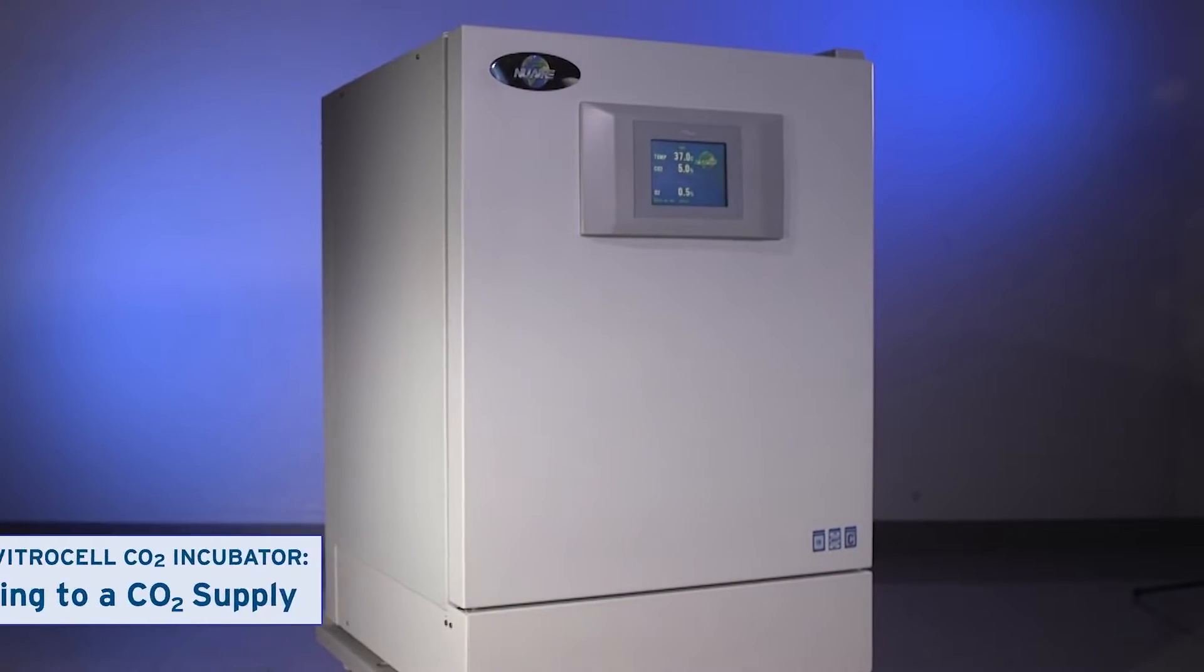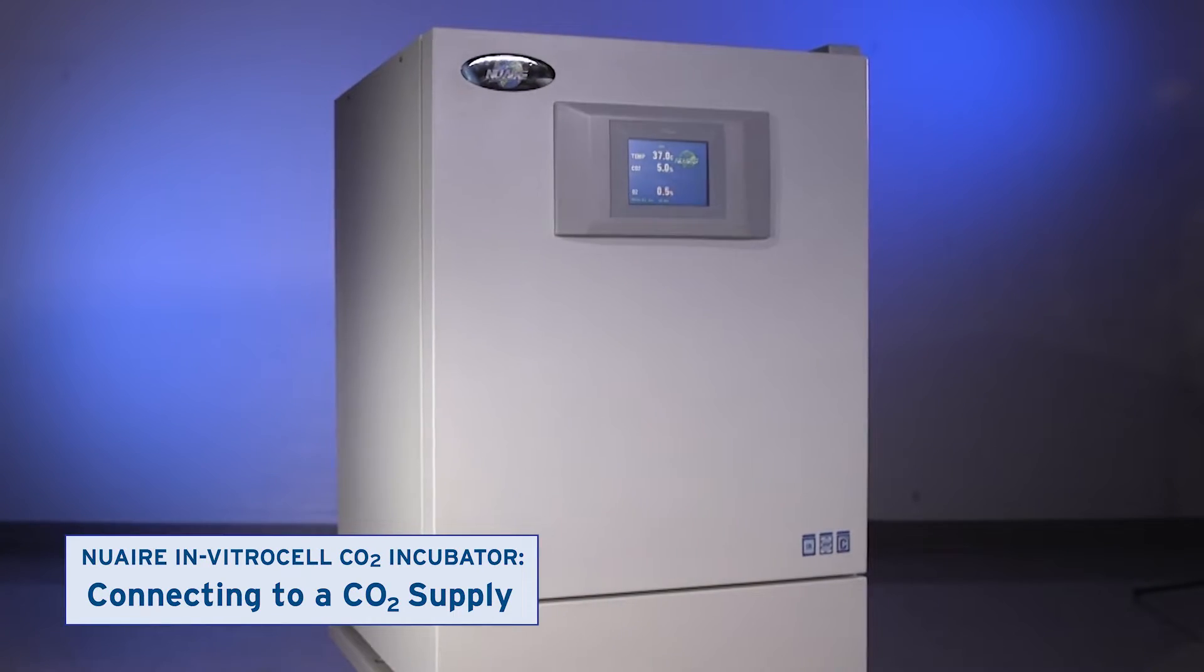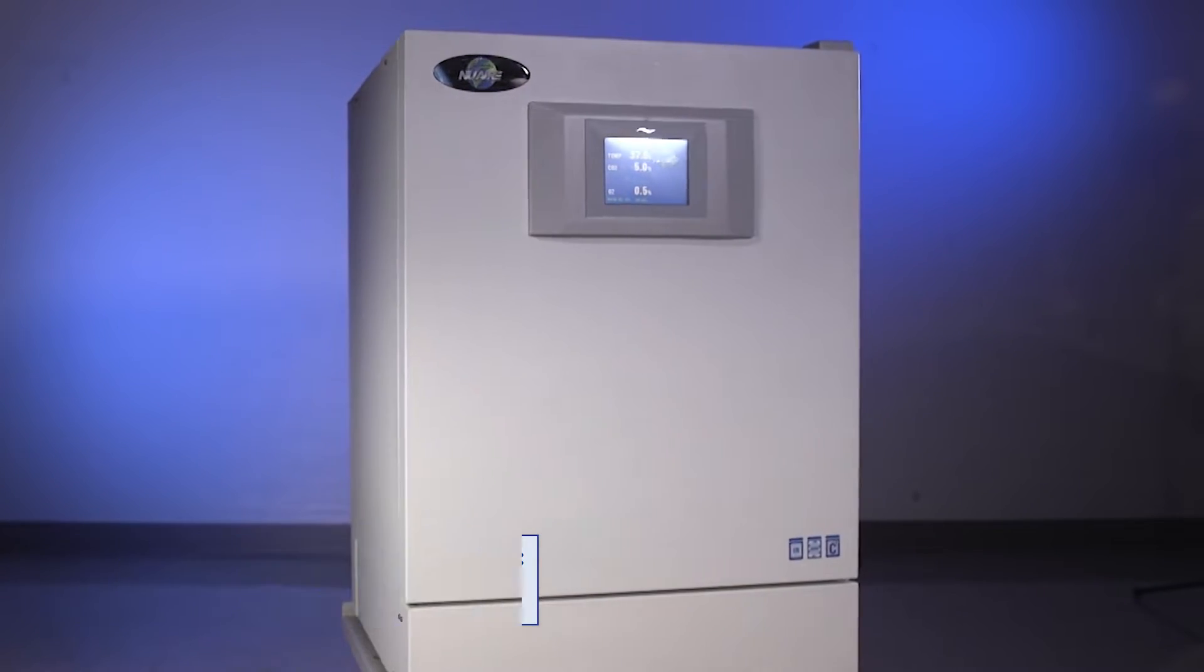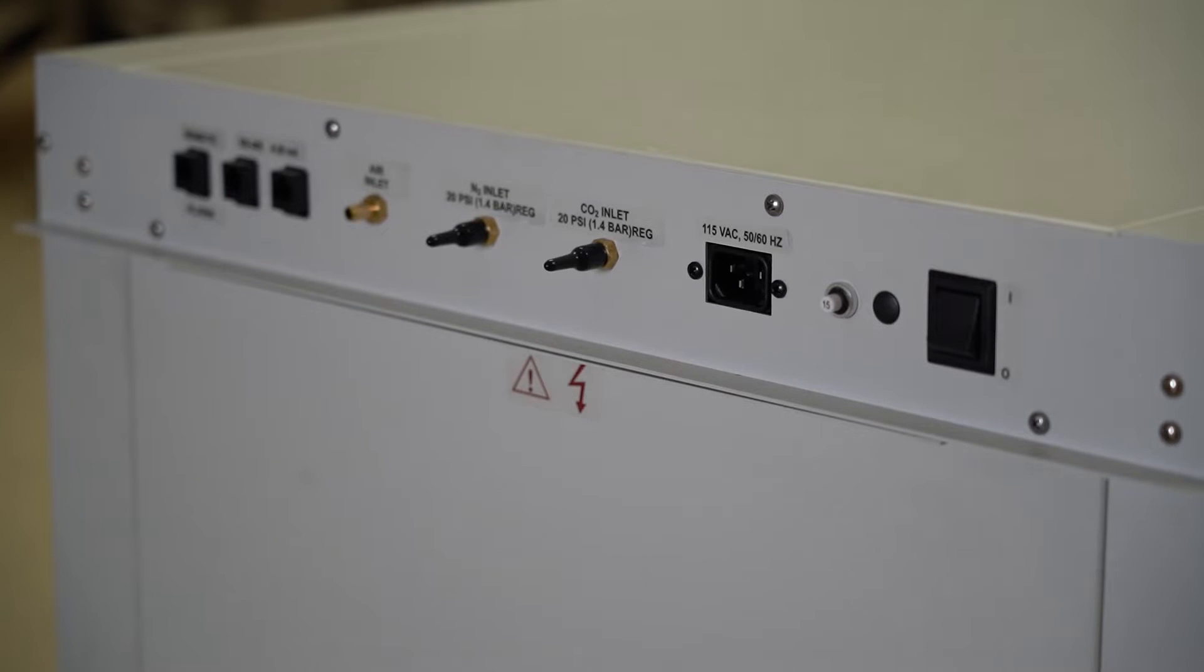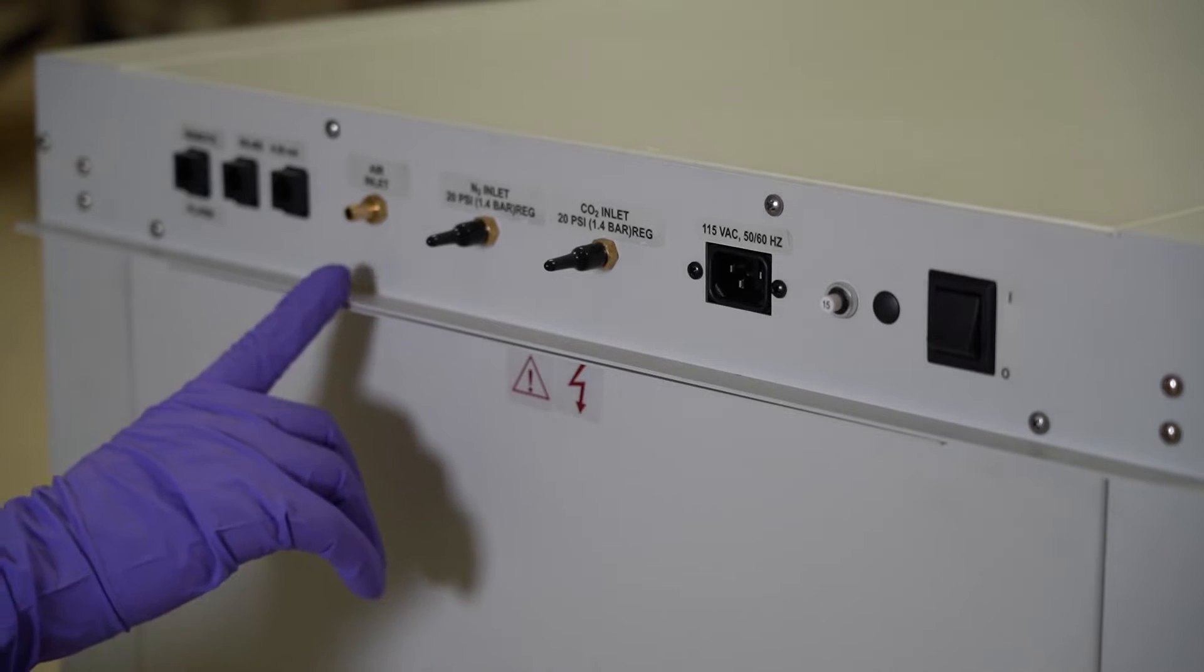This video shows how to connect your incubator to a CO2 supply. Start by finding the inlets for air and gas on the back of the incubator.